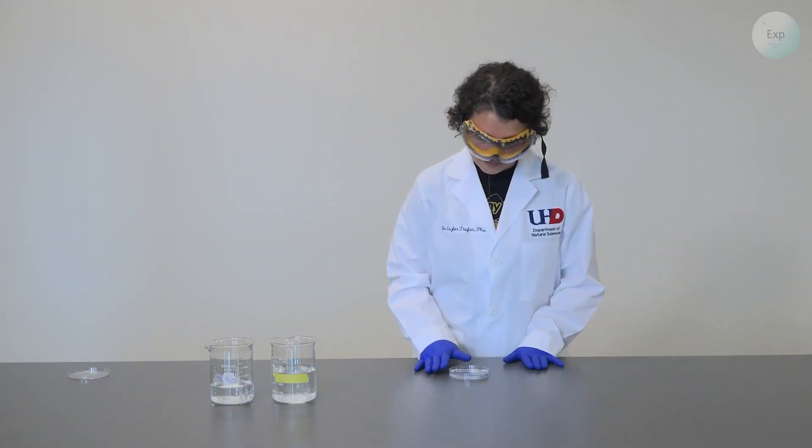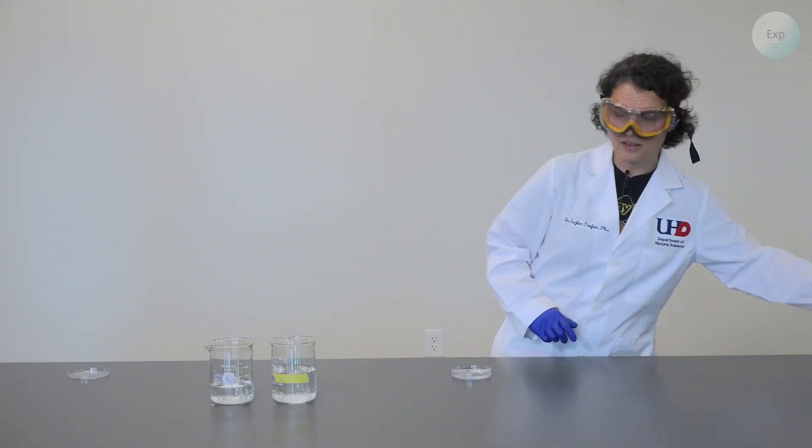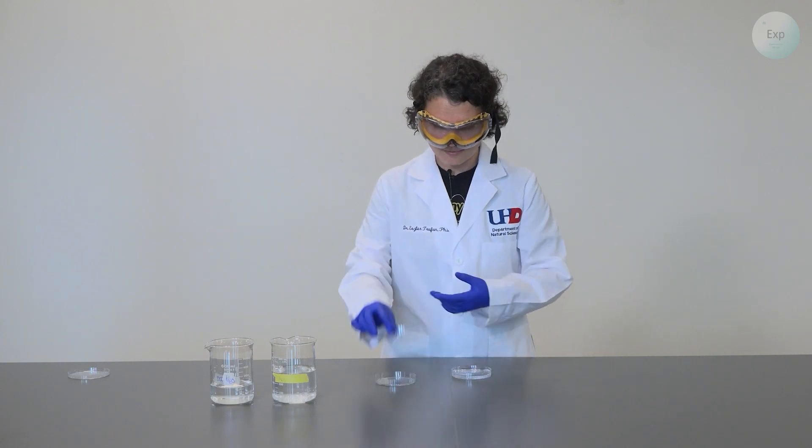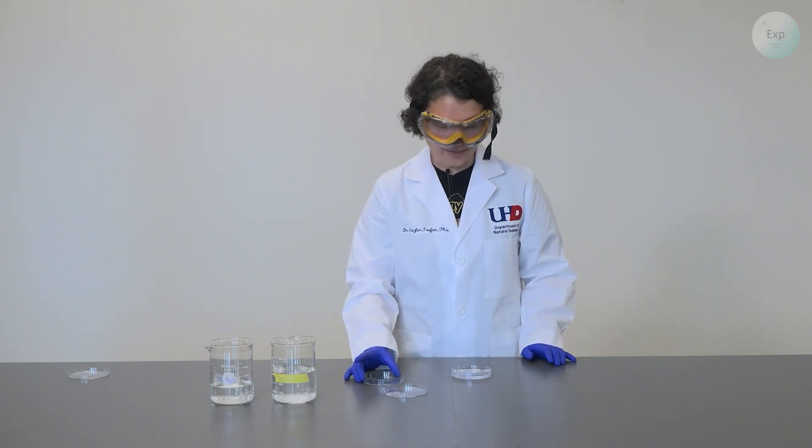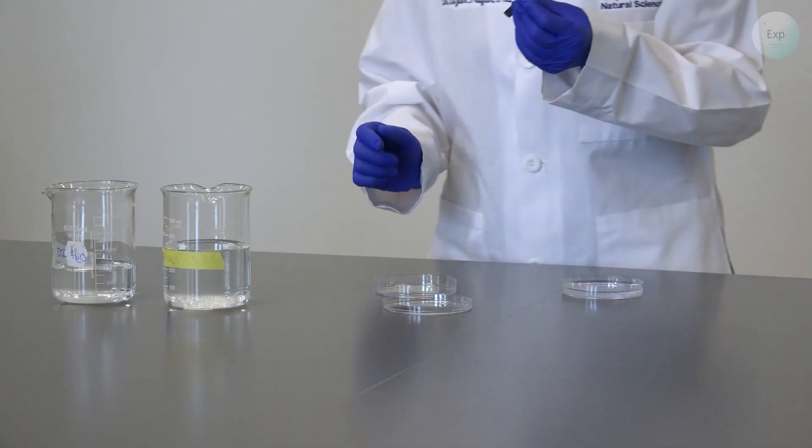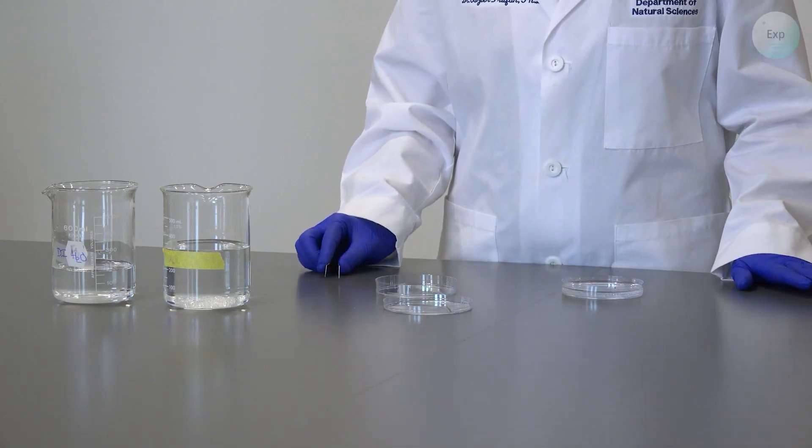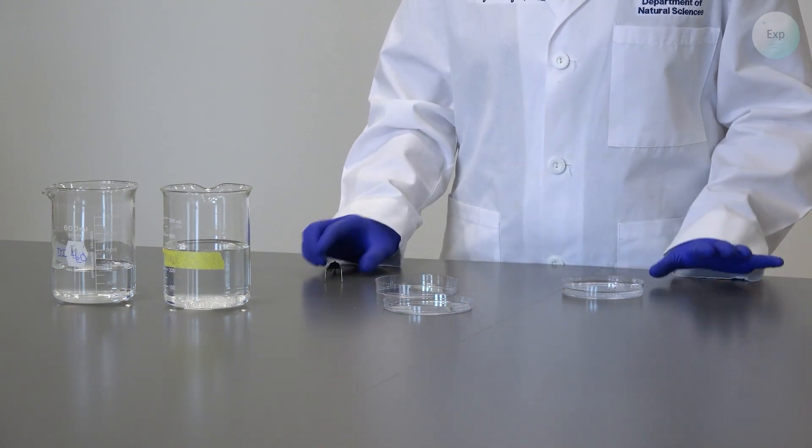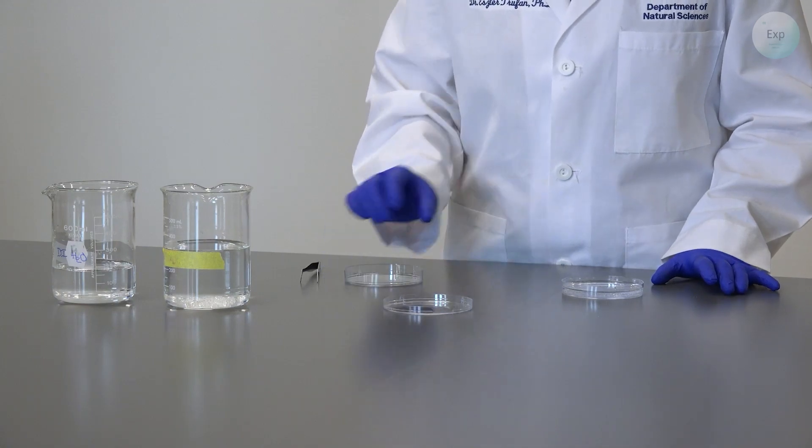So for this experiment, I am going to need another petri dish, which means the cap and the base. And I'm also going to use a tweezer that will allow me to very carefully move my crystals from one container to the next.